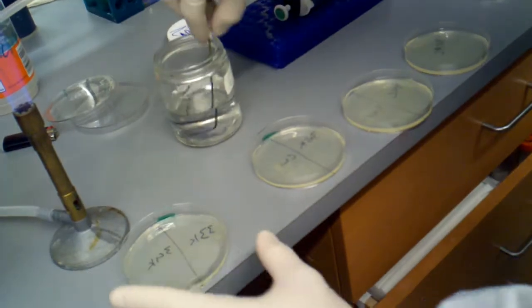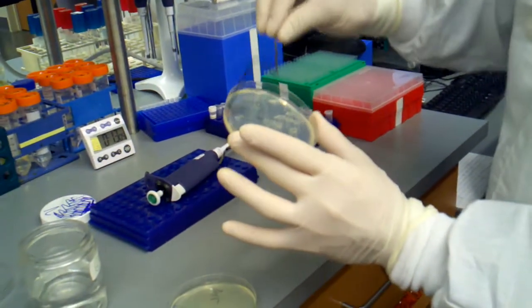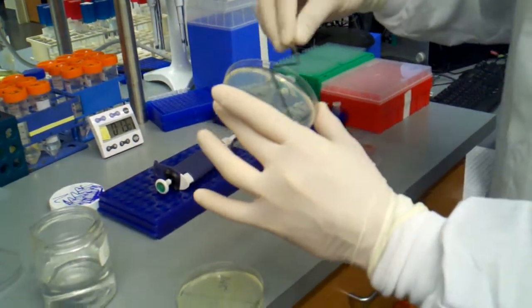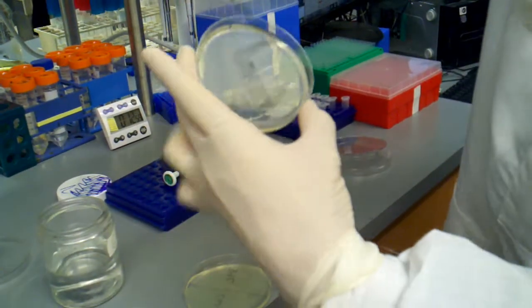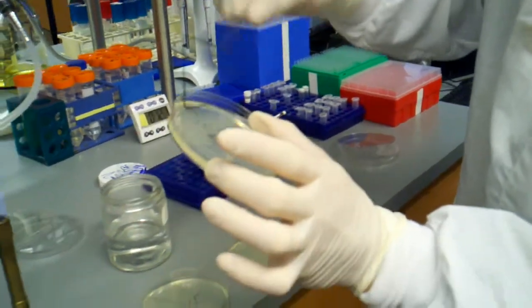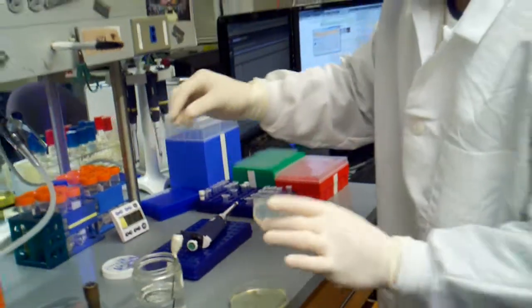So that sample one has been spread, and then we have our last sample right here. So since this is a full plate, I can be a little bit more wasteful as far as space goes. And then we're good to go.